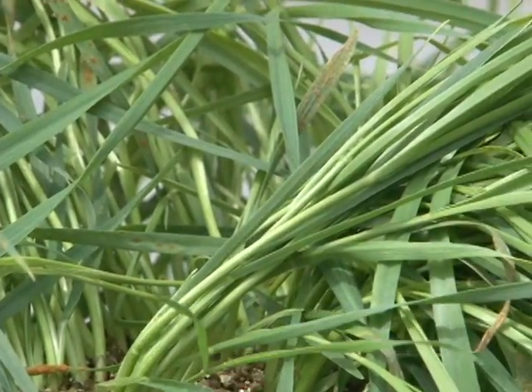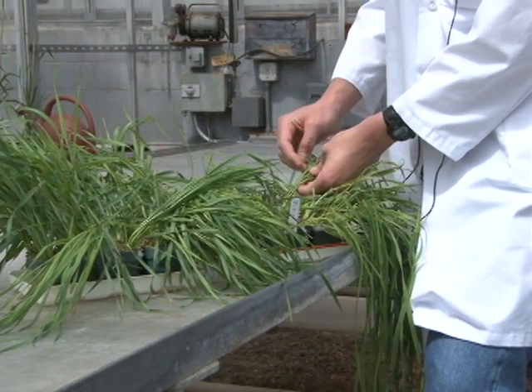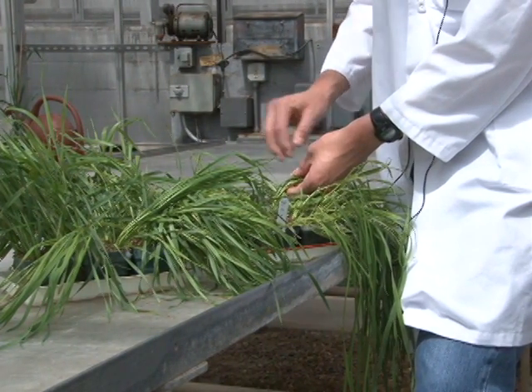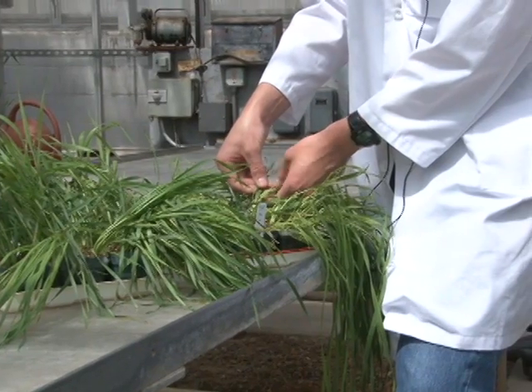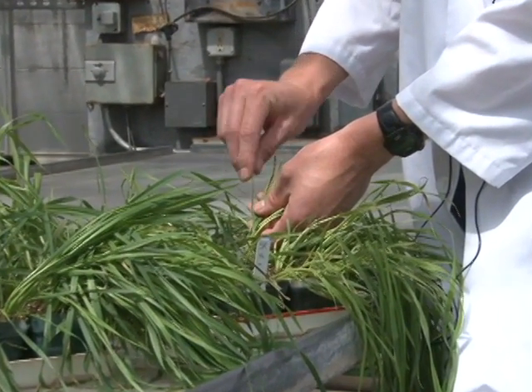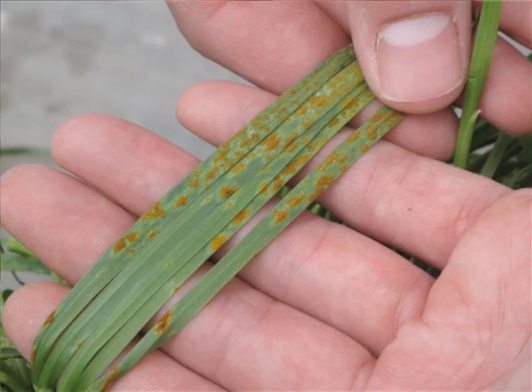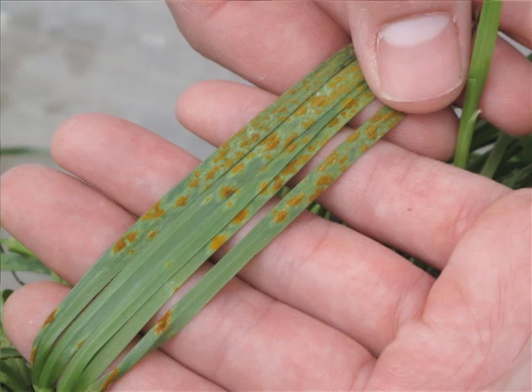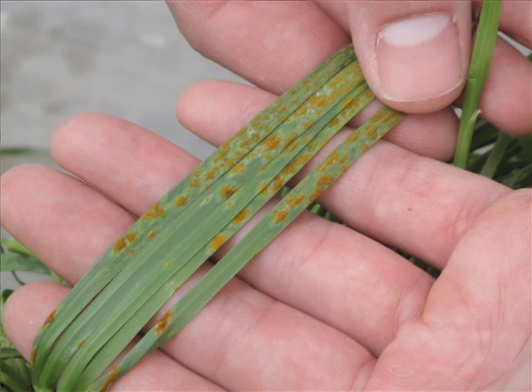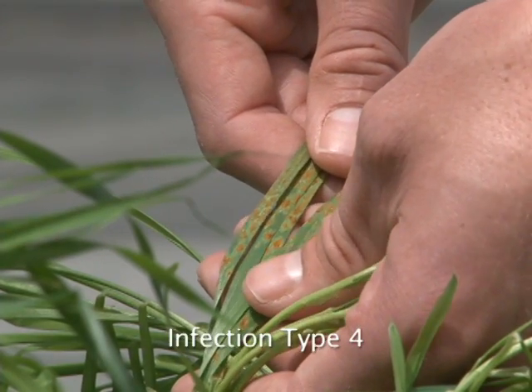In contrast to that, this monogenic line has the resistance gene SR10. SR10, in reaction to the isolate of rust that has been inoculated here, is showing complete compatibility. You can see the large pustules that are diamond shaped and elongated. So this infection type we classify as a four.